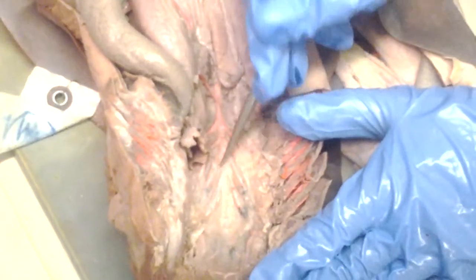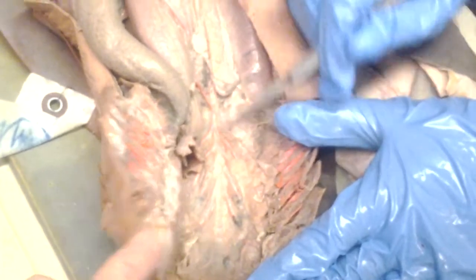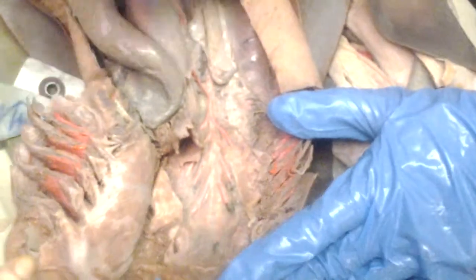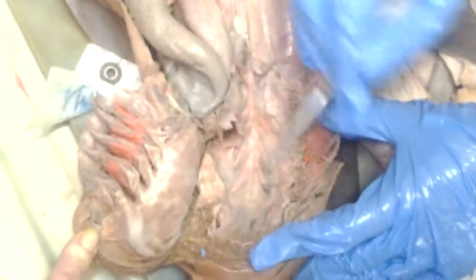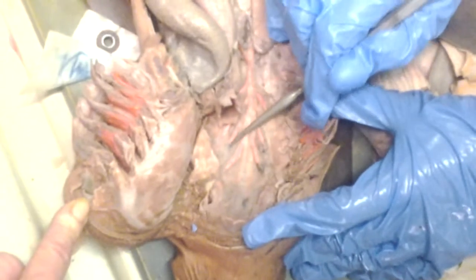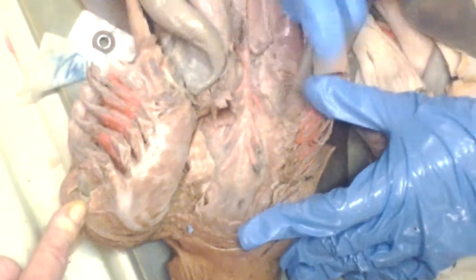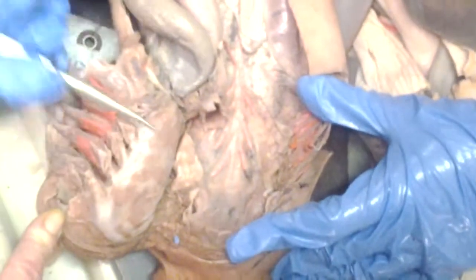These are the efferent branchial arteries, and this connects to the dorsal aorta. You're not going to see the ventral aorta because it doesn't come off. It's inside here. So the dorsal aorta is here, efferent branchial arteries here, and afferent branchial arteries are inside here, along with the ventral aorta. Can you just move it? Can you show it?